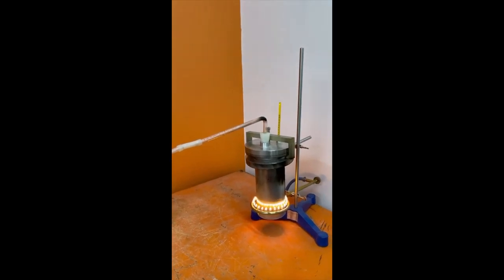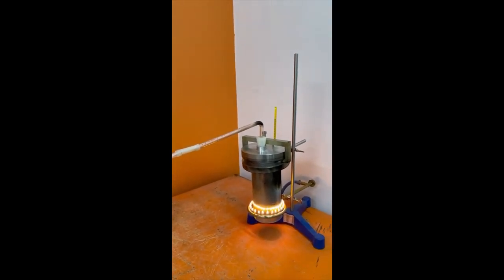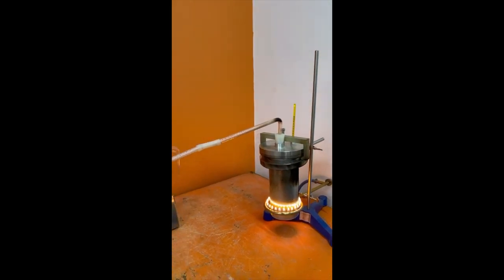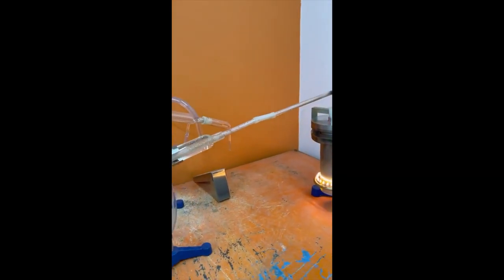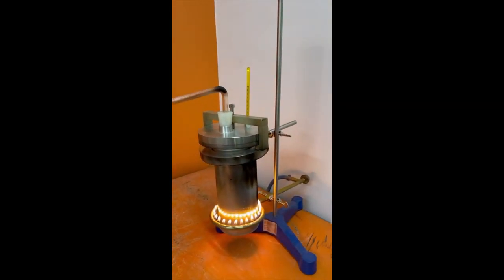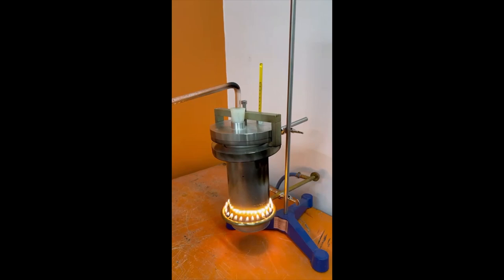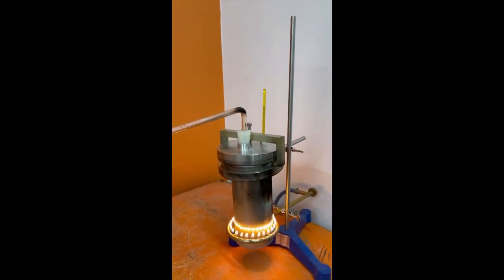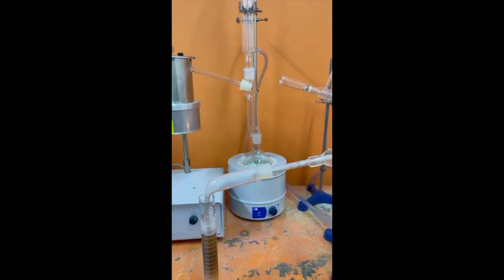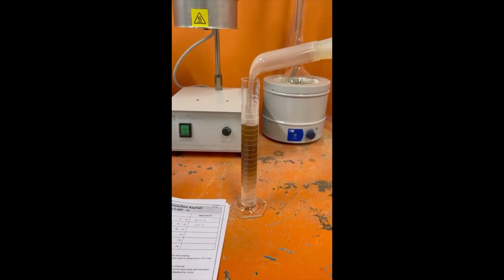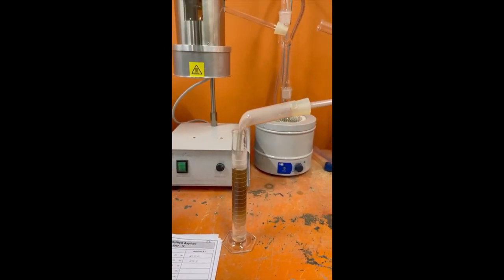Okay, now we come back to the test of the distillation of emulsified asphalt as per ASTM D6997. Now we reach 260 degrees and the ring burner is now at the bottom of the steel apparatus. We already collected the distillate oil and water here. This is distillate oil and water. Now we keep this for 15 minutes and we will take the final readings.